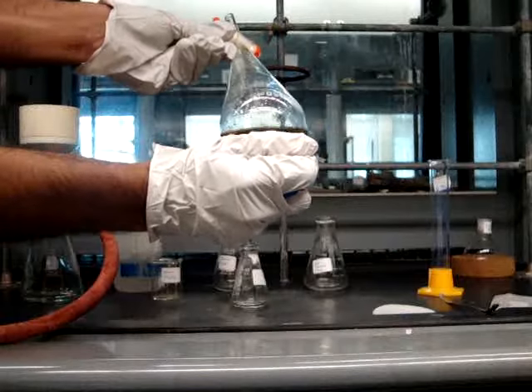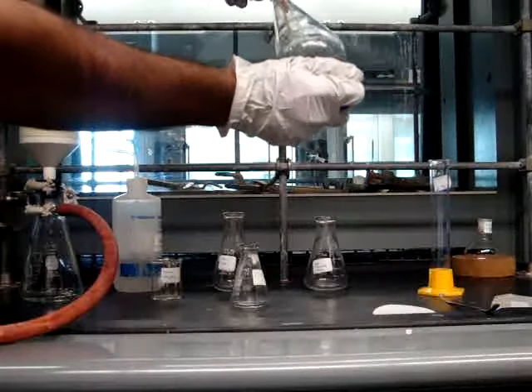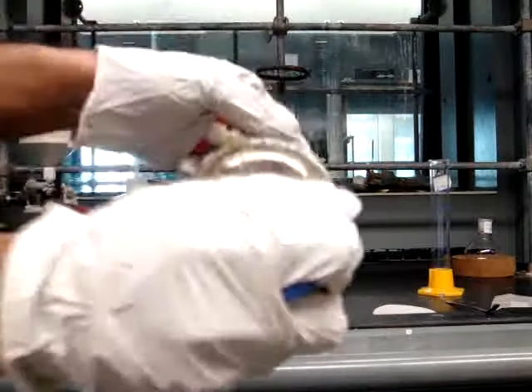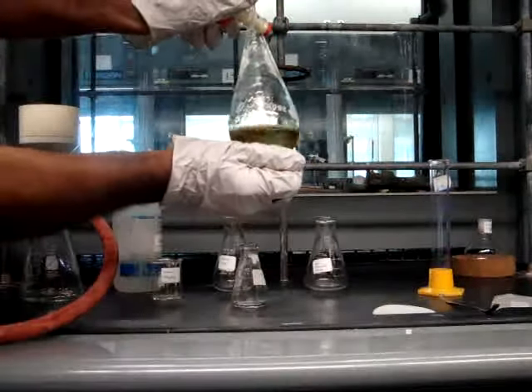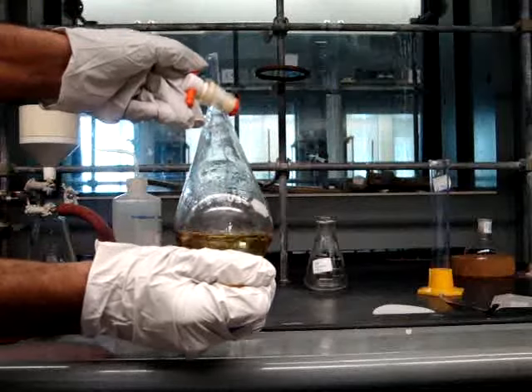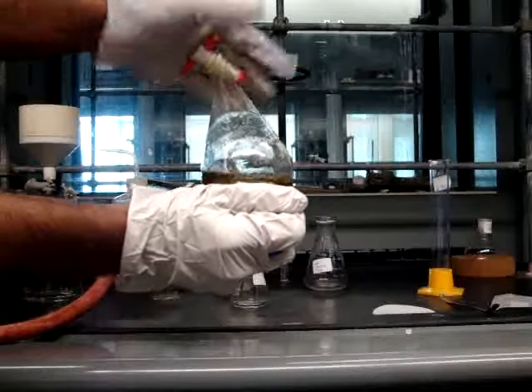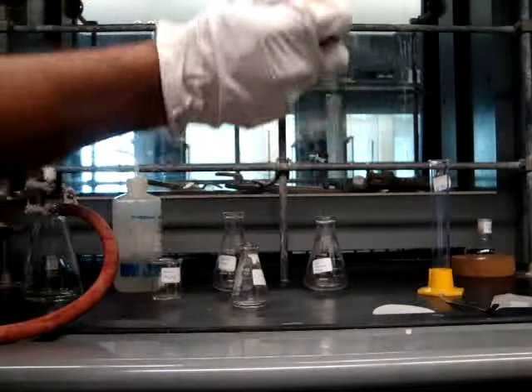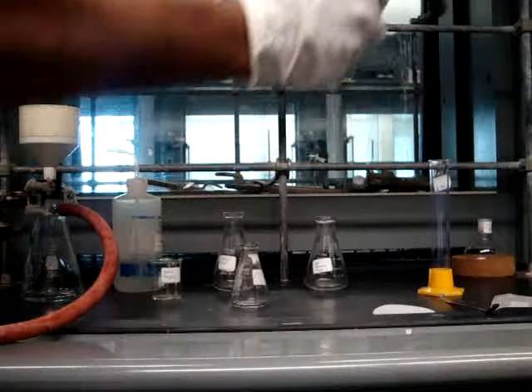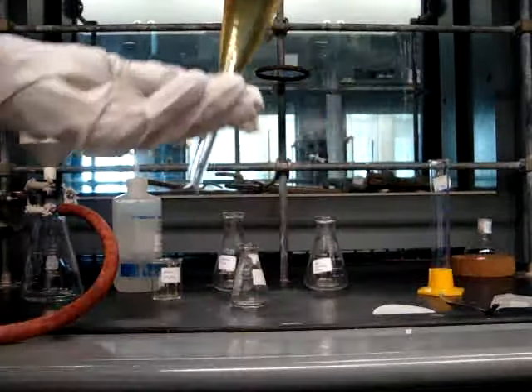Now you can turn the clasp to release the excess pressure. Make sure when you're doing so, you're pointing the bottom of the separatory funnel away from yourself and your neighbors. Now close the clasp and you want to shake the separatory funnel. You don't want to shake it too hard because emulsions will form. Then continue to vent again by opening the clasp and releasing the excess pressure. Venting is very important to do often while you're mixing your liquids. You can do this process a couple of times to make sure that the compound that you're trying to partition between the two phases has moved completely into the other phase.